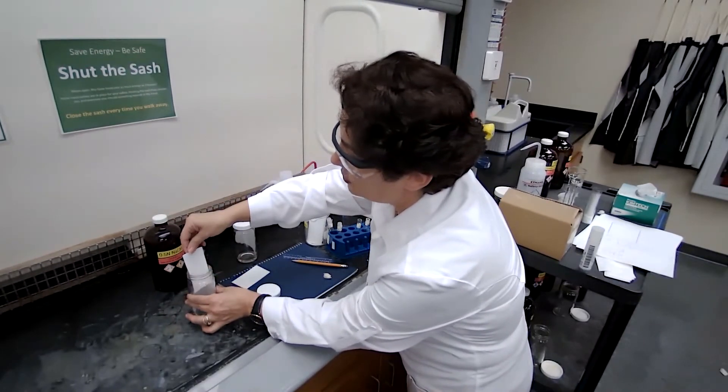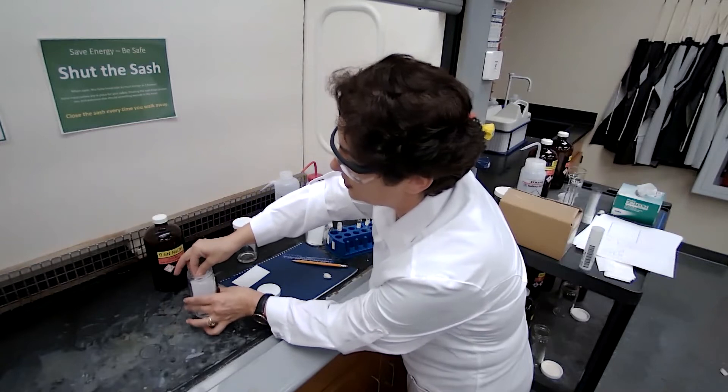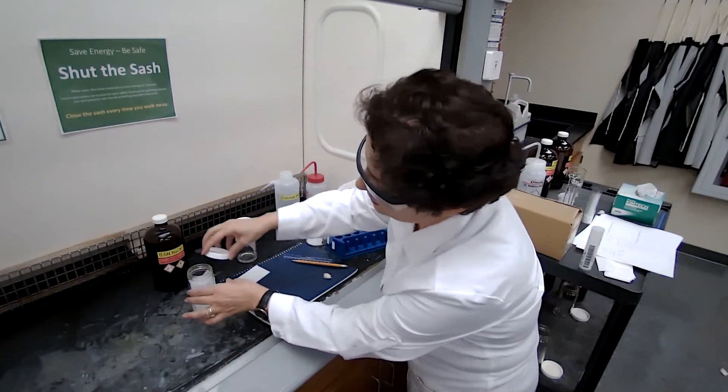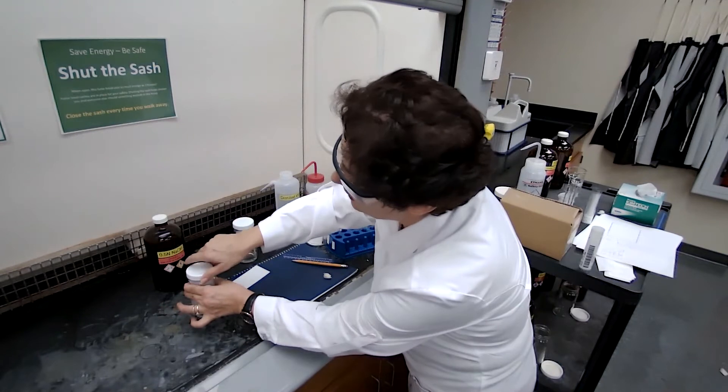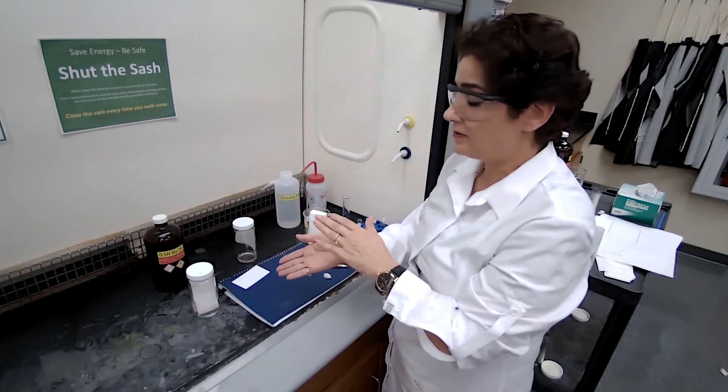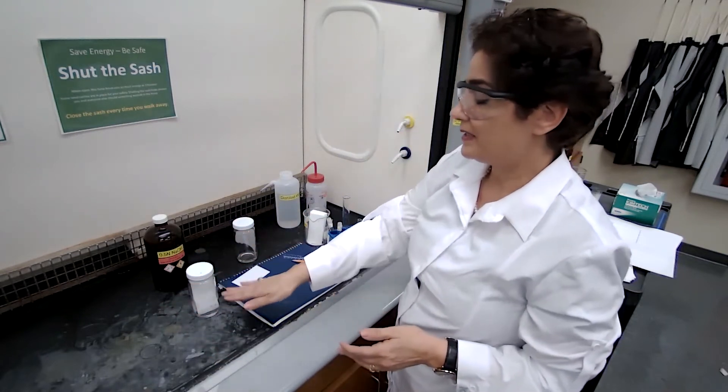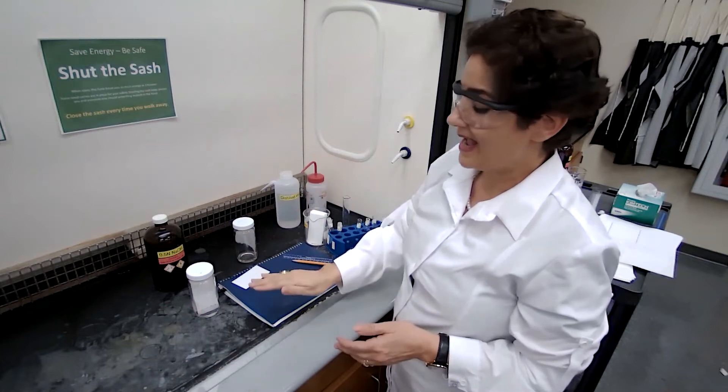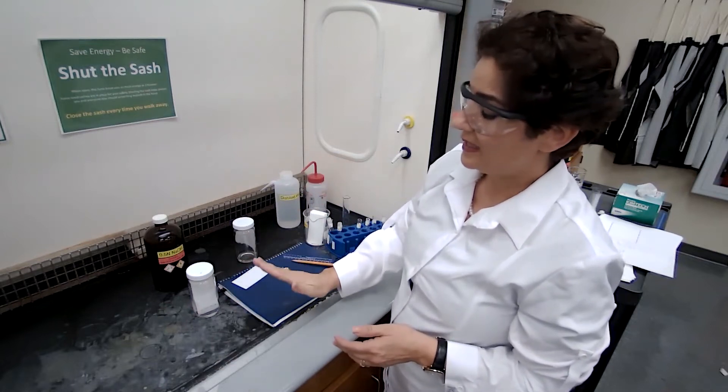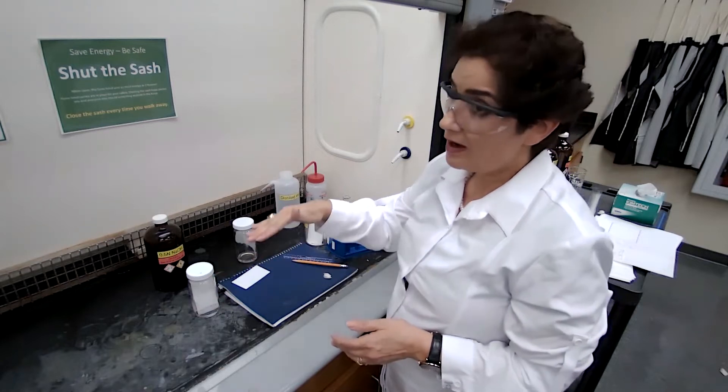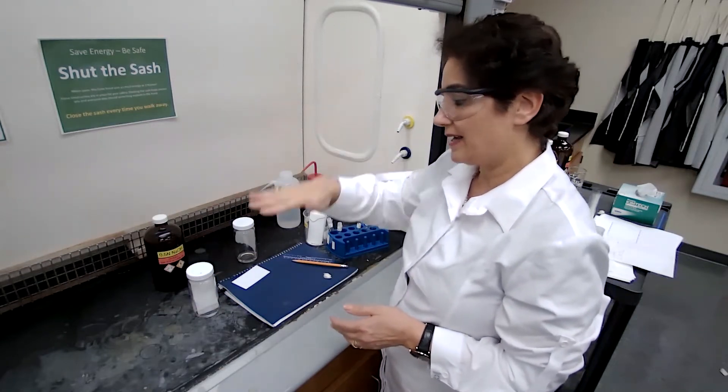You don't want this to touch the surface, to touch the filter paper. Just want to make sure that it stays still. You should not disturb it, because if you disturb it the liquid is going to make waves, and as the liquid makes waves it can also make the line not a straight line.